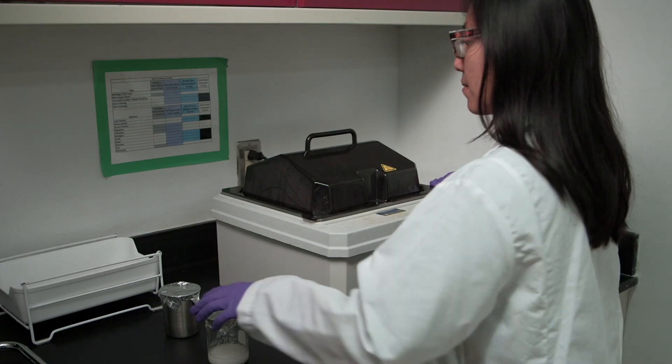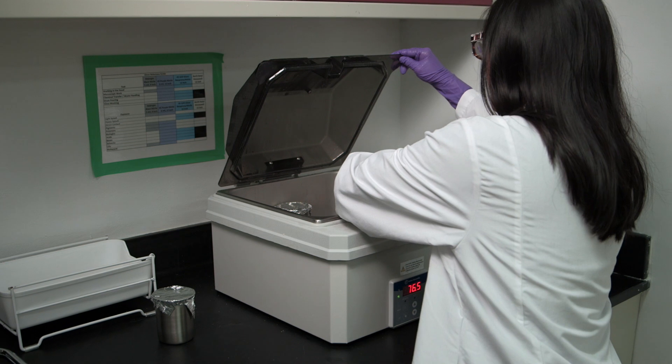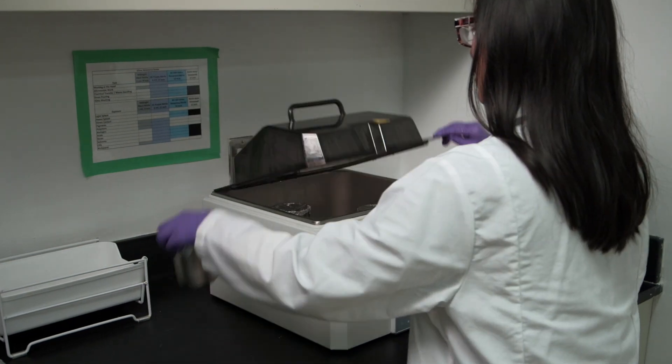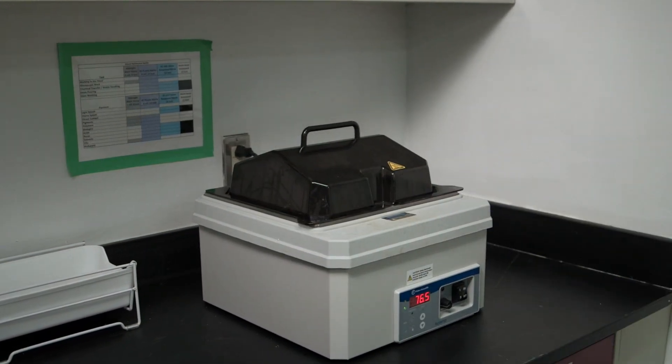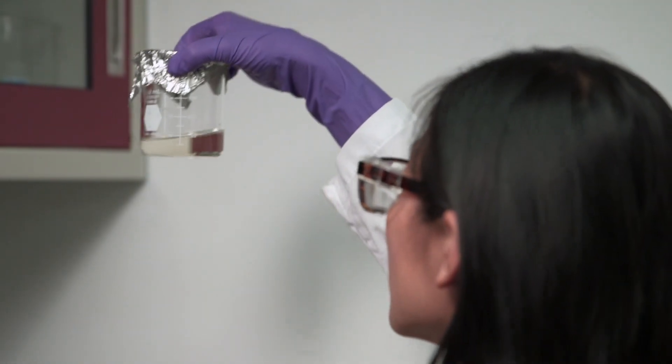Cream formulations begin by heating the formulation components, which are often solids, so all products are sufficiently melted. The two phases are heated separately.